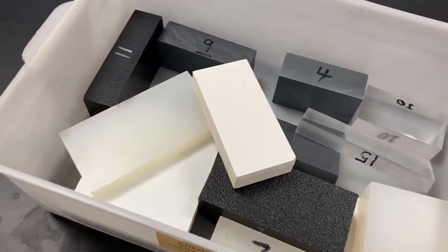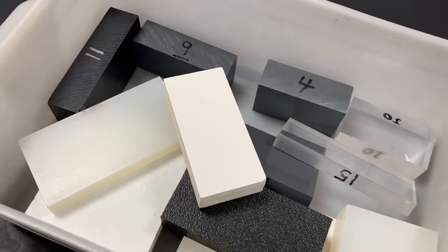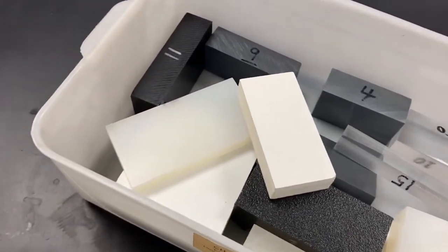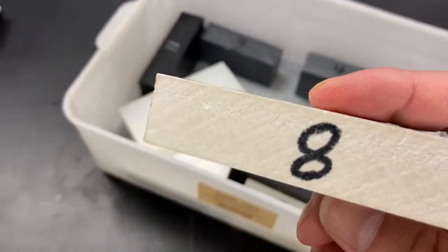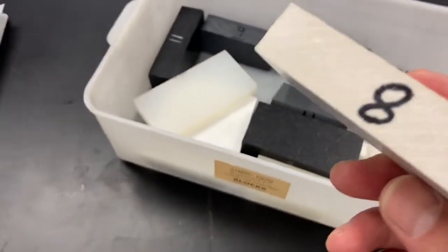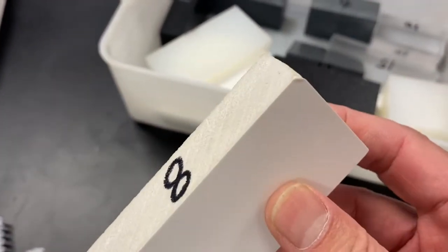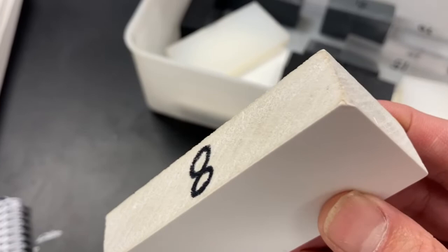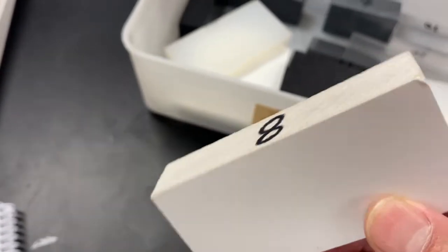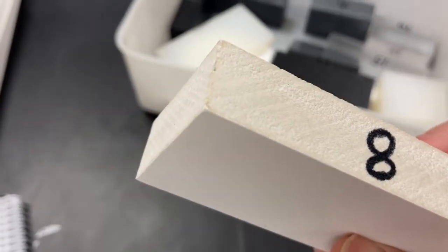The first section is the measurement of the density of a regular shaped object. We're gonna pick one sample from here and take the first one. Code number 8. Make sure you record 8 on your report sheet. Sample number 8 is what we will use. We're gonna measure the mass of it, then we'll measure the volume of it. Well, there's no direct way to measure the volume of this. We're gonna measure the length, width, and the height of it.